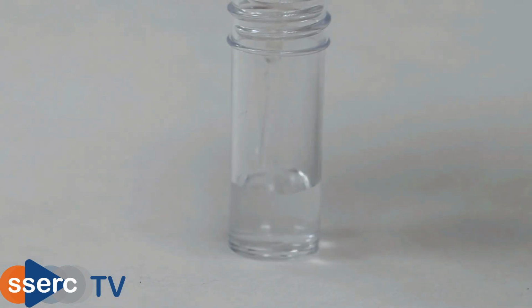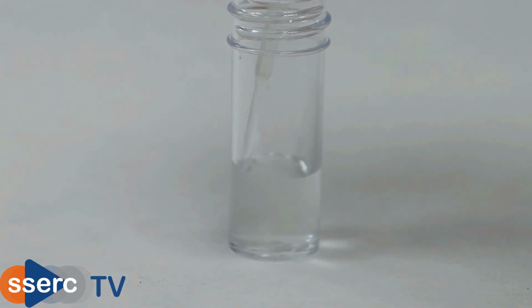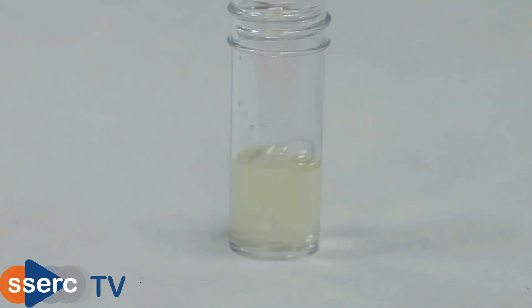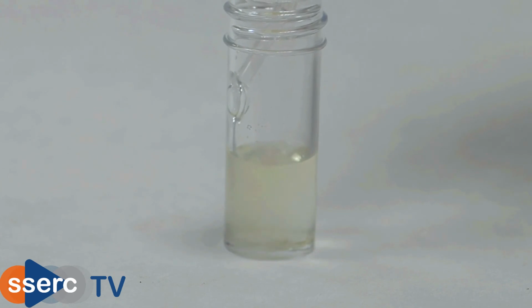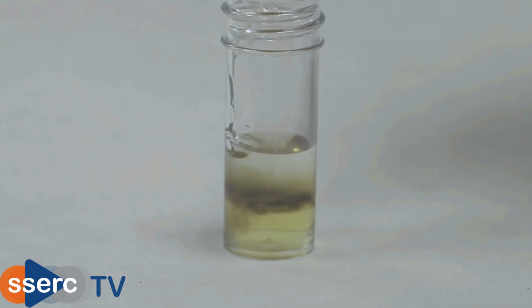Nitrates are a little harder, as all nitrates are soluble in water, so we can't make a precipitate. To test for nitrates, we use what's known as the brown ring test. We add some iron(II) sulfate to our nitrate solution, mix, and then carefully trickle some concentrated sulfuric acid down the side. If a nitrate is present, you get a brown layer, sometimes in a ring shape, where the liquid layers meet.